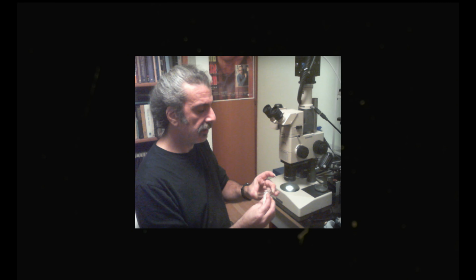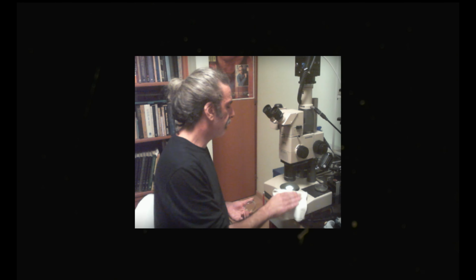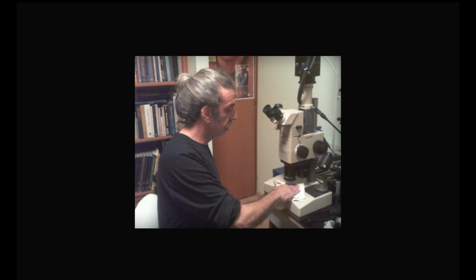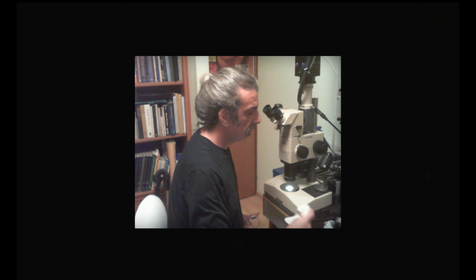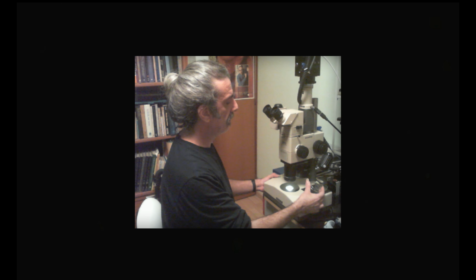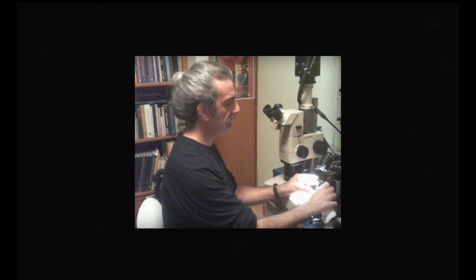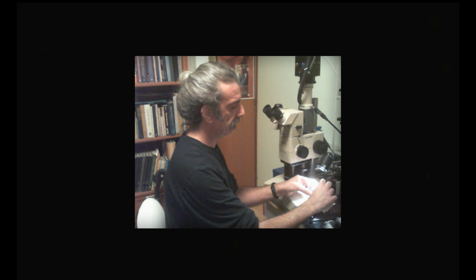Because we are using dark field illumination, cleaning is very important because you'll see every detail of debris or dirt, and it will hamper your viewing. And I've got this black patch here for a reason, because against the black we can see much better if there is any dust on our glass.